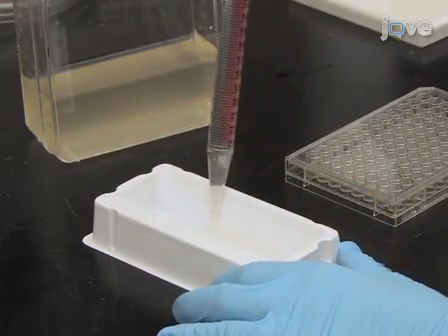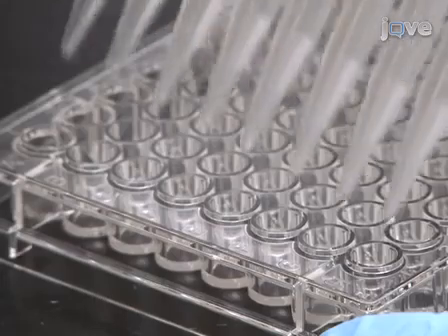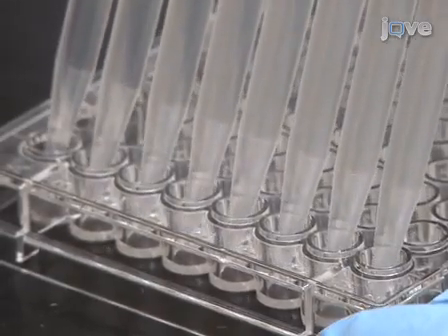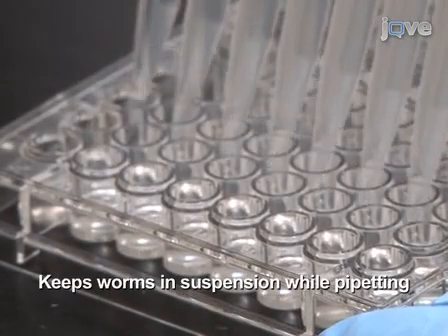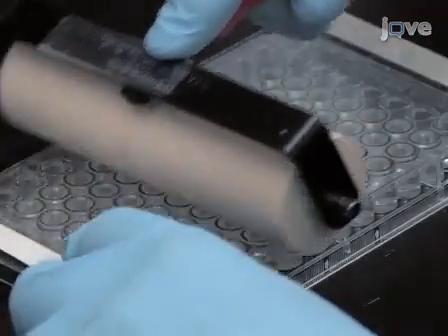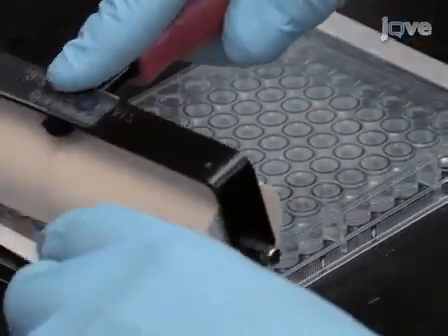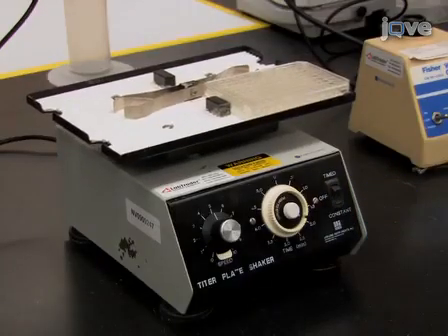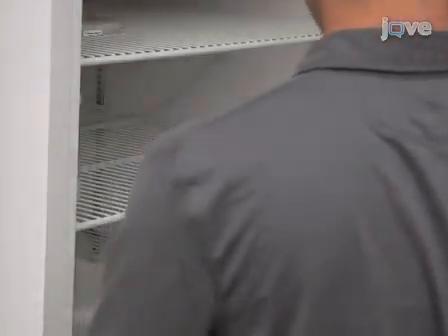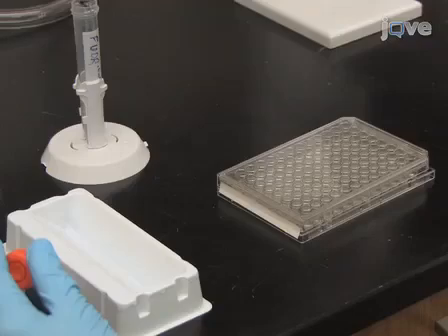Transfer 120 microliters of the worm OP50 solution into each well of a 96 well plate with the transparent bottom. Make sure to keep the worms in suspension while pipetting. Seal the plate using a tape sealer to avoid contamination and evaporation. Shake the plate on a microtiter plate shaker for 2 minutes and incubate for 2 days at 20 degrees Celsius until the animals reach the L4 stage.